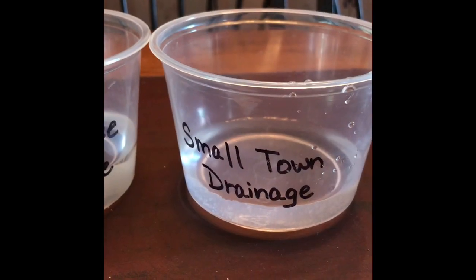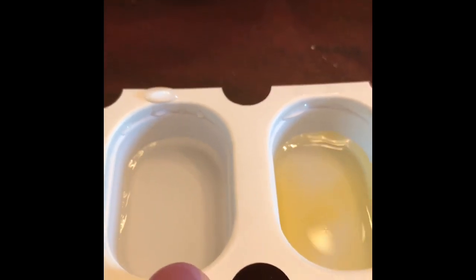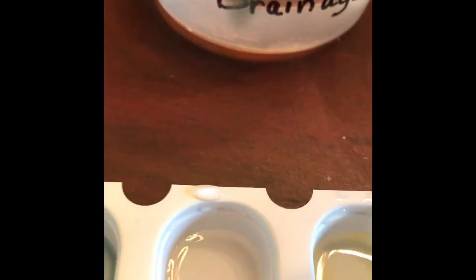Okay, we're now going to test the small town drainage. Again, I've already put a small amount of that water sample in our little boat. And I'm going to add a few drops of our phosphate indicator. Okay, so you can note the color change of that water sample, and you can record that on your data sheet. Remember, yellow, phosphate levels are too high, and a blue or green, phosphate levels are okay for fish to live. Could the phosphate levels be causing the fish to die in the Gray Bay area?